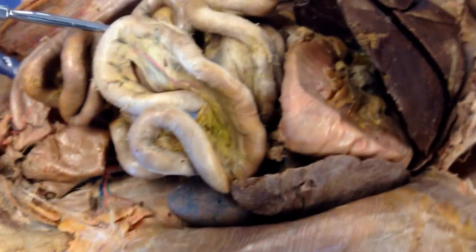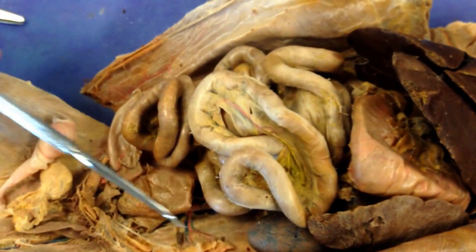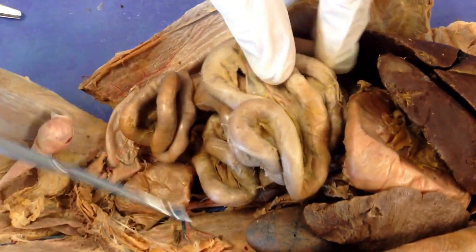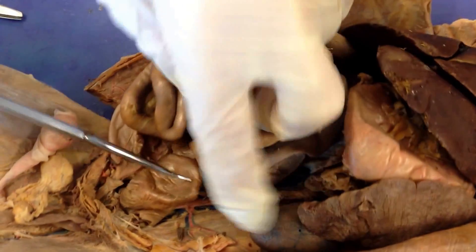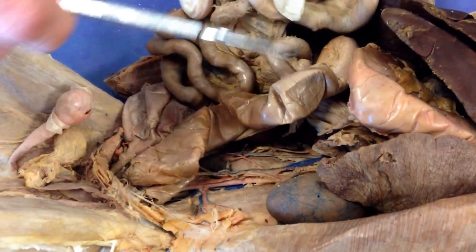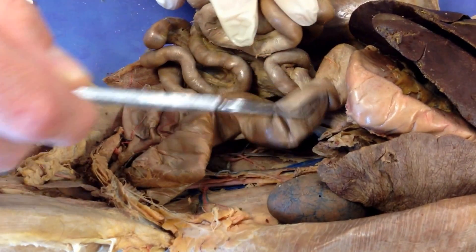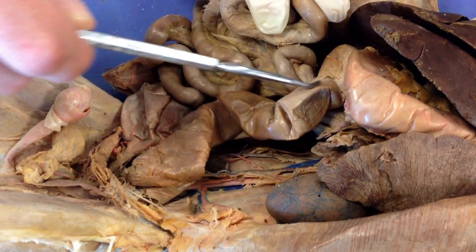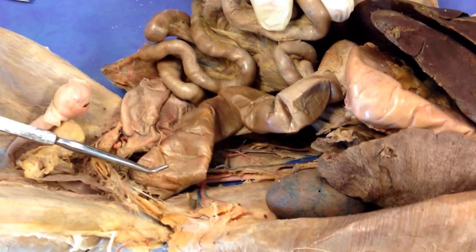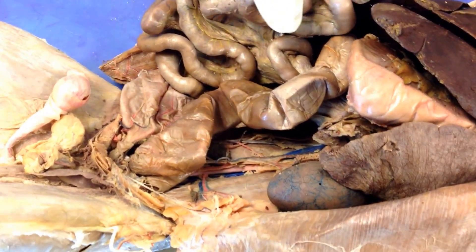All of these coils are going to be small intestine. You can see a definite change in diameter when you go to large intestine. The large intestine takes a more direct shot going all the way down than the small intestine does.